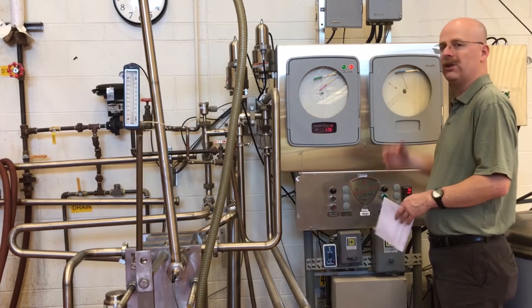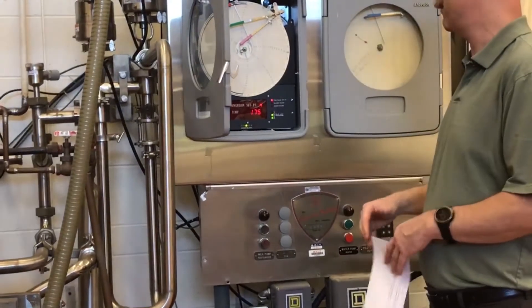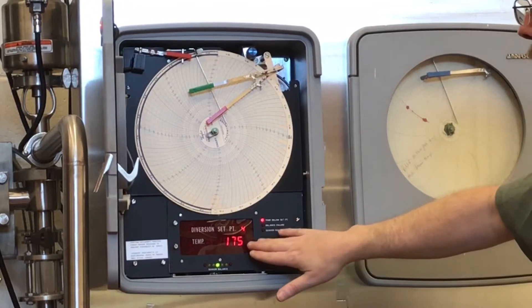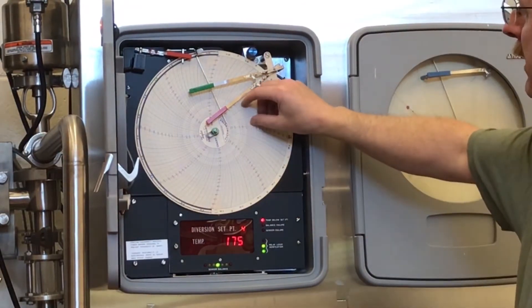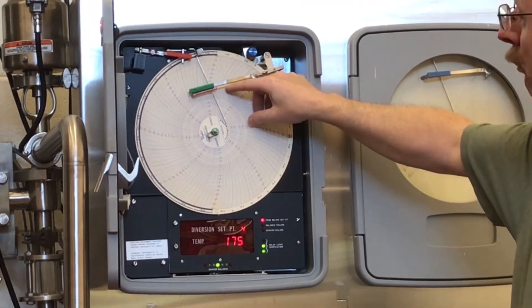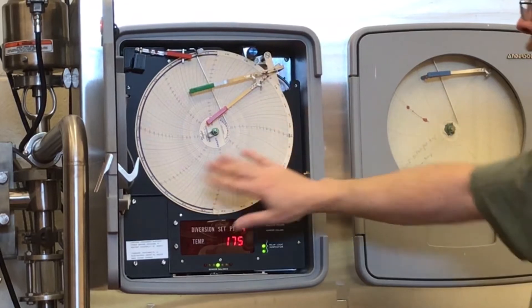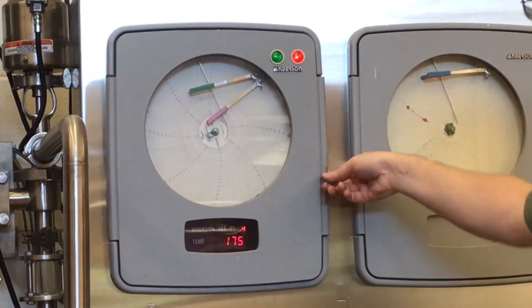We are looking now at our temperature controllers. We have a controller where we have the ability to set our process parameters and adjust the target temperature. When the system is running, we actually record the temperature as well — this needle will travel up to reach our target temperature, and a circular chart turns at a slow rate, providing a permanent record monitoring the temperature of the milk. This is a permanent time record that will be part of your HACCP plan or CCP specifically.